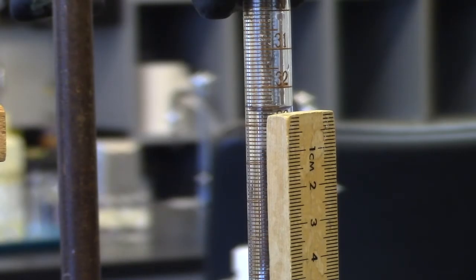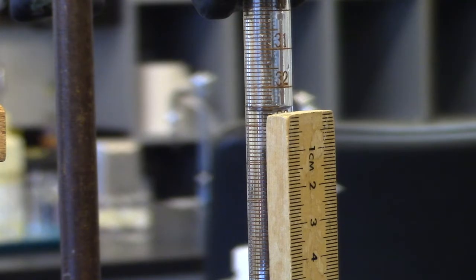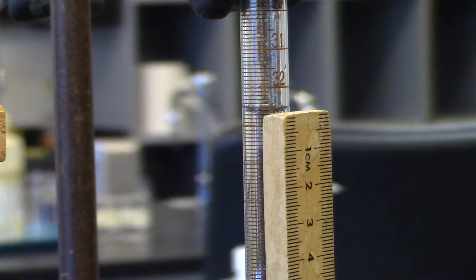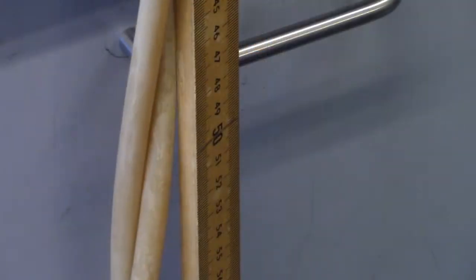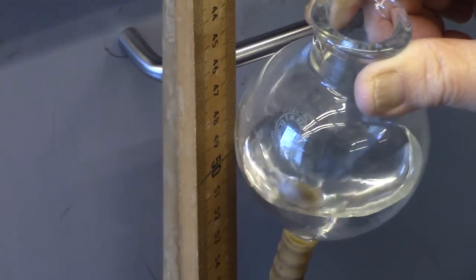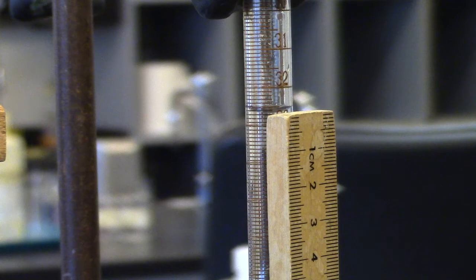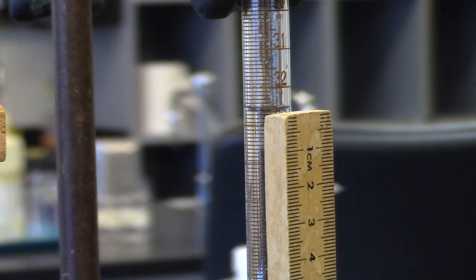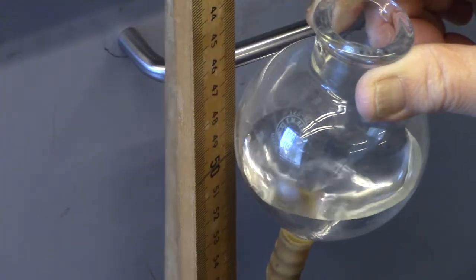Starting with the negative height measurements, slide the manometer to the edge of the bench. The zero end of the meter stick will be aligned with the water level in the manometer. The second student will lower the water level of leveling bulb to negative 50 centimeters. Meanwhile, the first student will be keeping the end of the meter stick aligned with the water level in the manometer. Once achieved, record the volume reading of the manometer along with the reading from the meter stick.